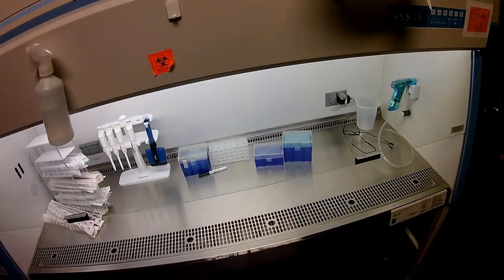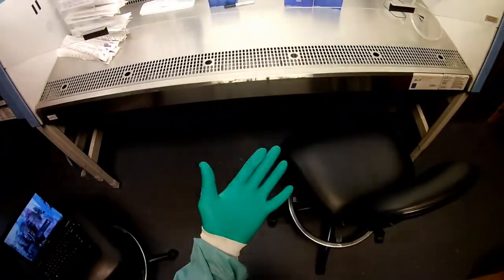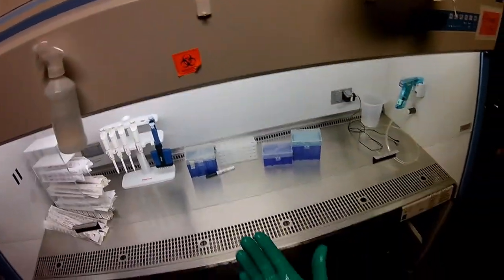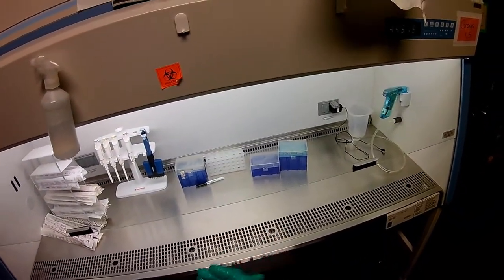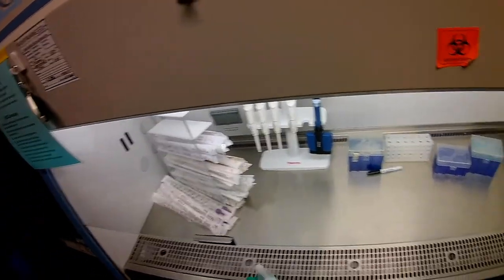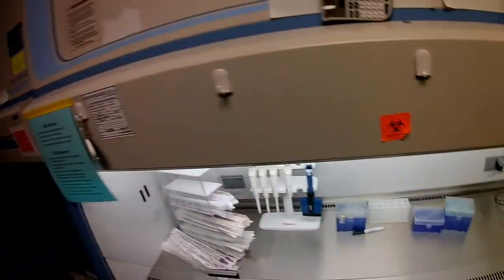Now again, we don't expect ethanol to sterilize anything, but it is going to just kind of clean things. So when you spray your hands, you definitely want to use a liberal amount of ethanol on your hands, rub it in really good, get all the spots. So when you stick your hands in there, they will be disinfected. We're going to go ahead and disinfect as much as we can the bottom surface of everything in there.